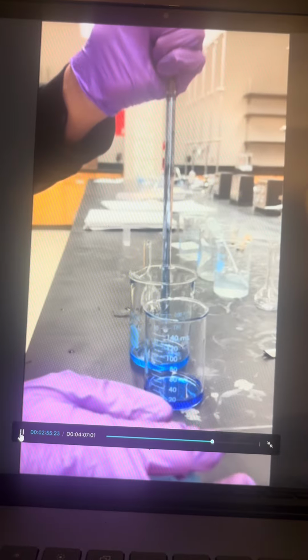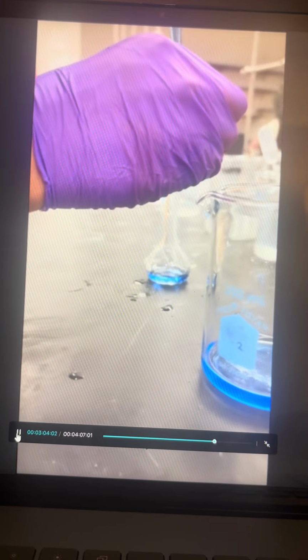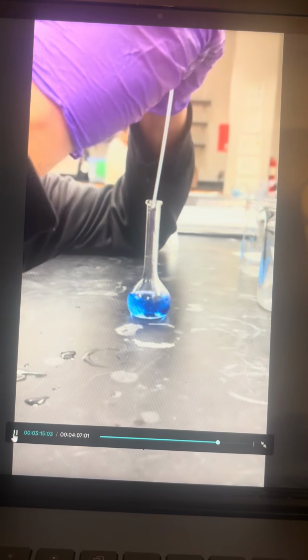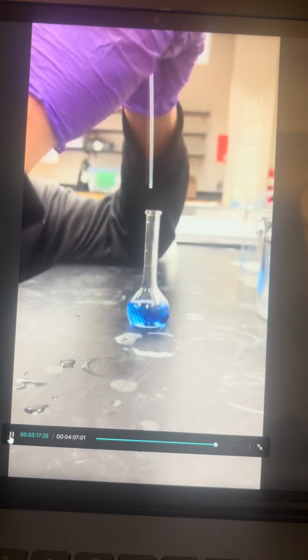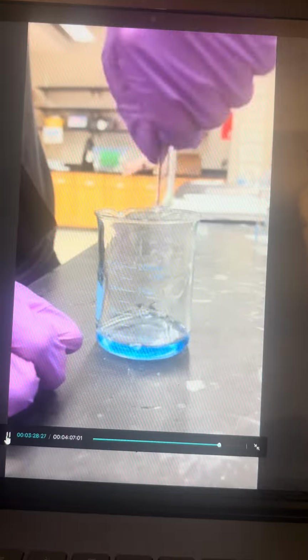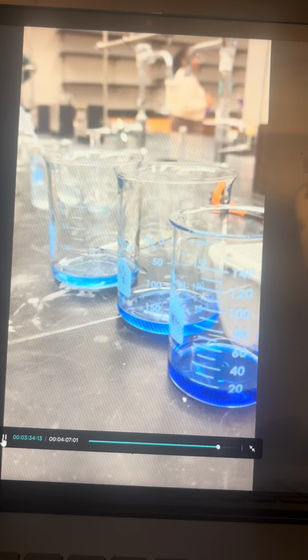We then perform our second dilution. As you can see, we are pouring only 10 milliliters of our first dilution to make our second dilution. It is very important that you consistently take the same drawn volume, or V1, and ending volume, or V2. If you do not, you will have a hard time calculating the unknown molarity of your dilution.